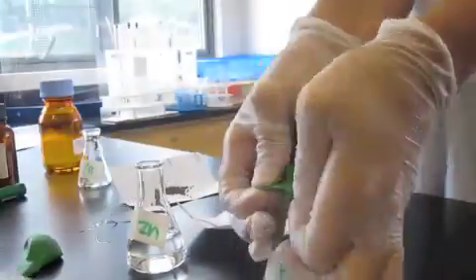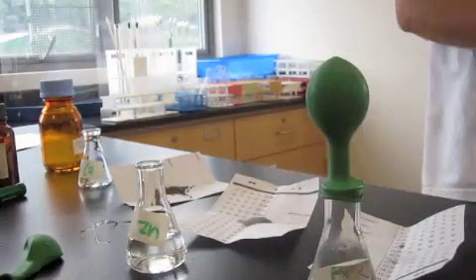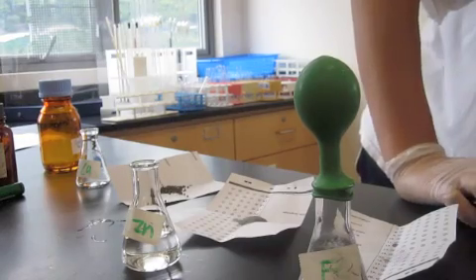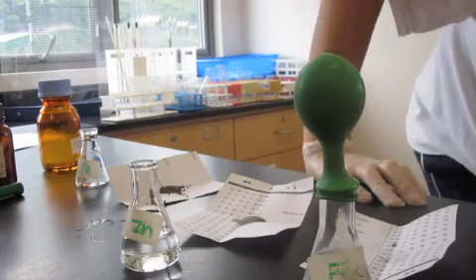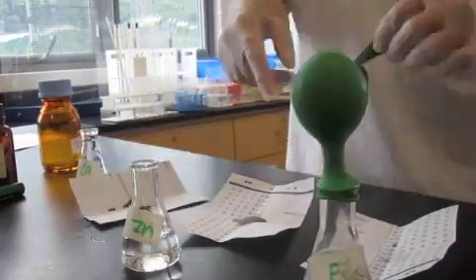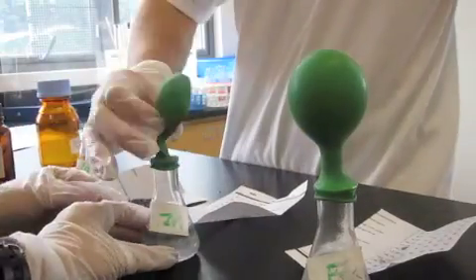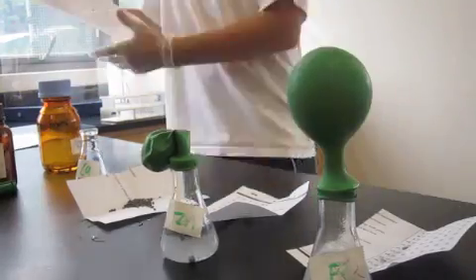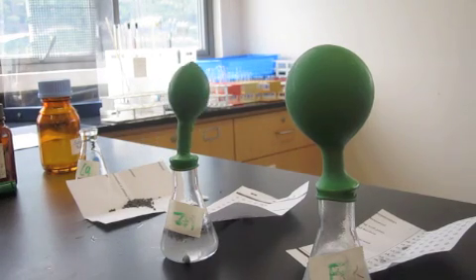Next, we poured iron powder into the flask and waited for the balloon to inflate. At this point, we swirled the flasks, especially iron and zinc, because we wanted to make sure the H2SO4 was touching all parts of the metal. Next, we poured zinc powder into a separate flask, then put the balloon on top for it to inflate. We also shook the flask to make sure that the H2SO4 was touching the zinc. We then did 2 other trials.